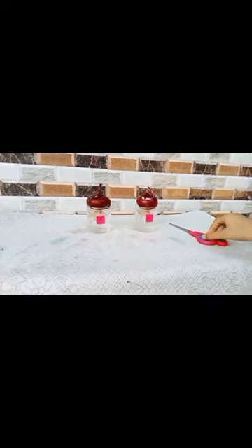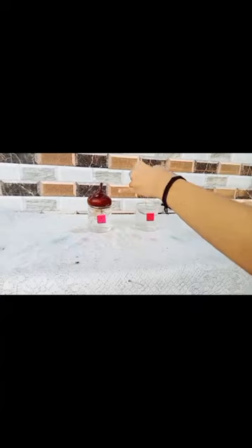As we all know, it is day three today. I am going to cut the root tips of the onion bulb in tumbler B with the help of a scissor. We will cut the roots of the onion gently at the bottom of tumbler B.